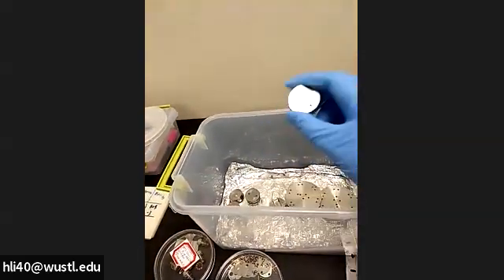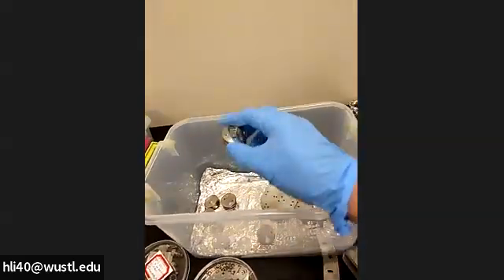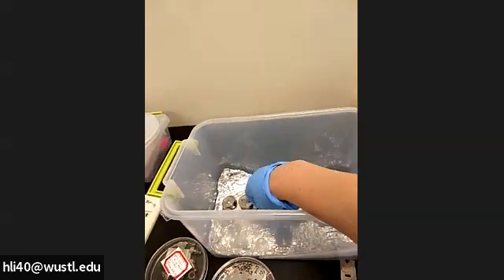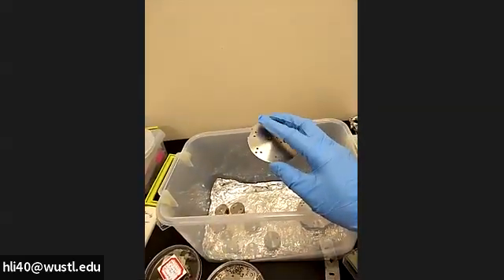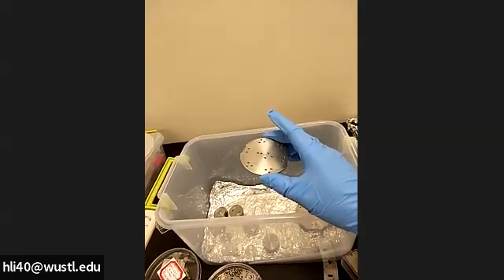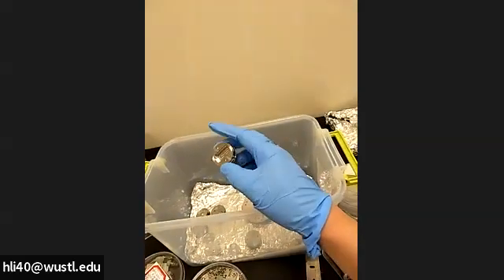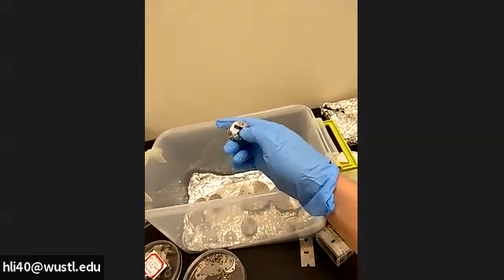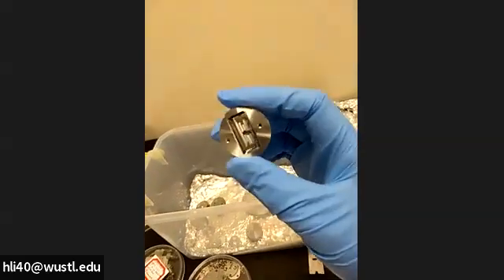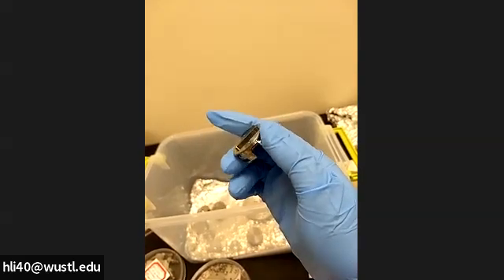For the user, you're supposed to use the plain 25 millimeter holder. If your sample happens to be tall, the maximum sample height with the flat holder is eight millimeters. You cannot have a taller sample than that, but if you have a tall sample it can fit into the gap or hole on the recessed holder.